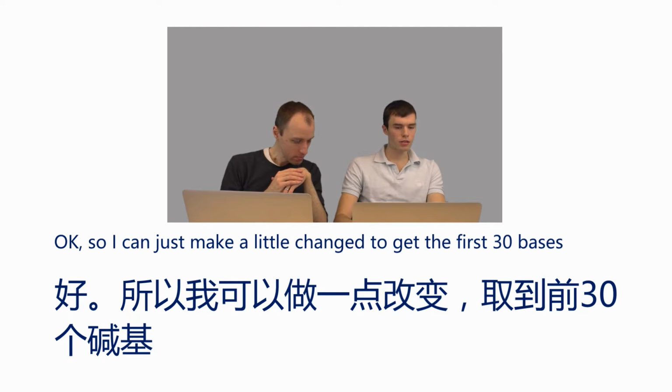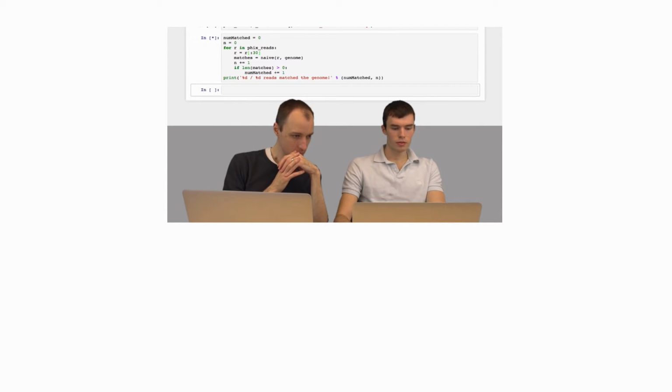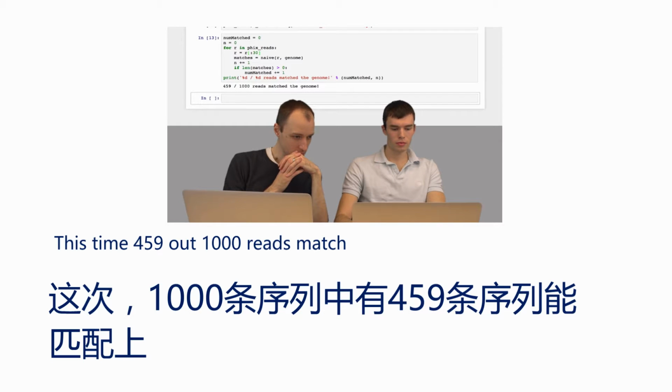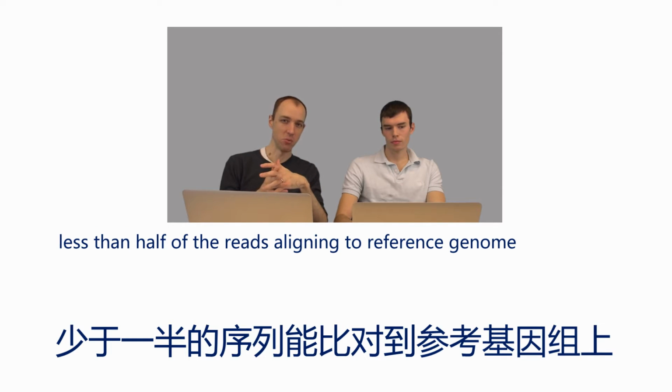Okay, so I can just make a little change to get the first 30 bases. I'm going to set R equal to just the 30 base prefix of R. I'm going to run it again. And this time, 459 out of 1,000 reads matched, so a little under 1/2. So this still isn't very close to 1,000, right? This is less than half of the reads aligning to our reference genome.